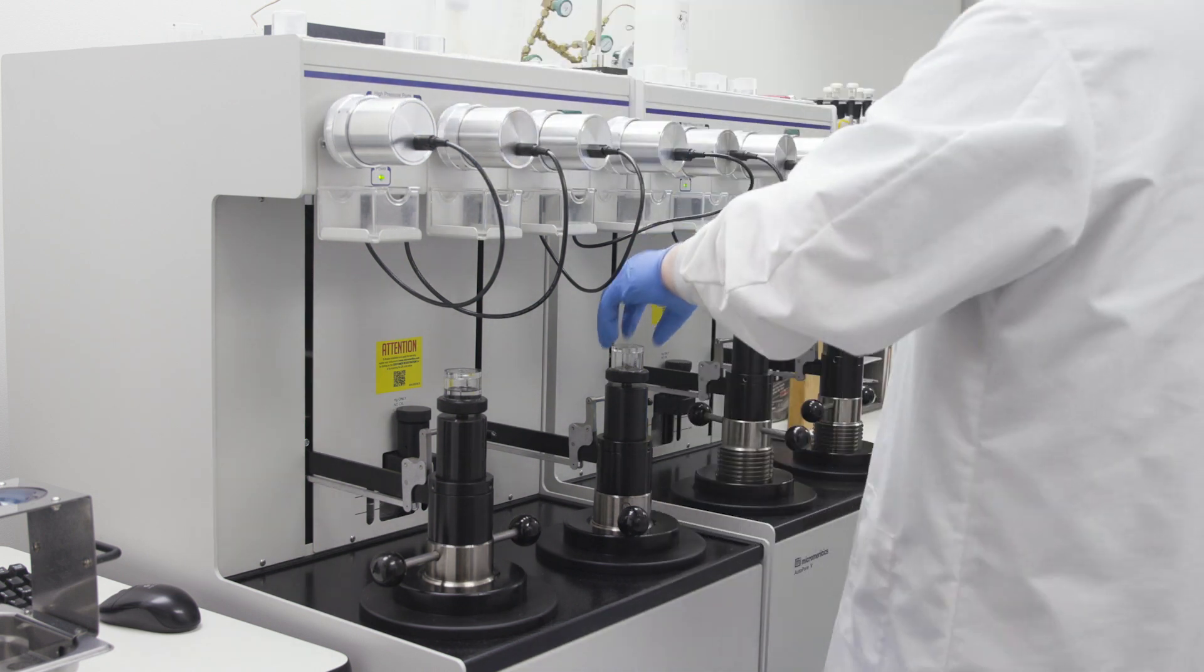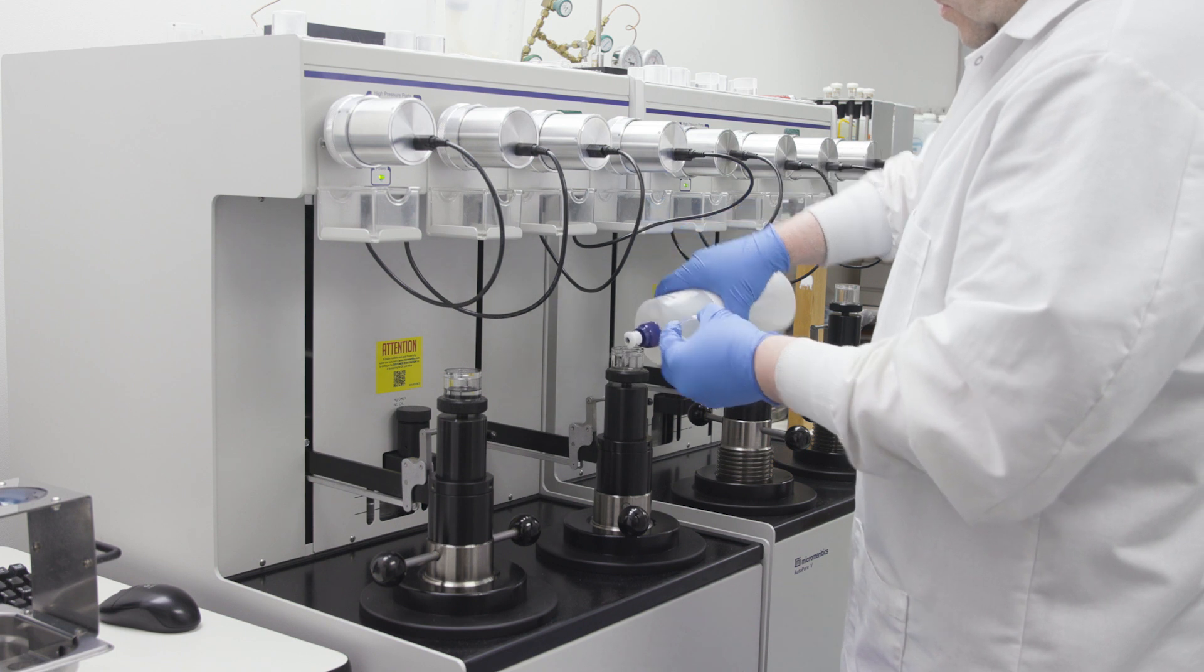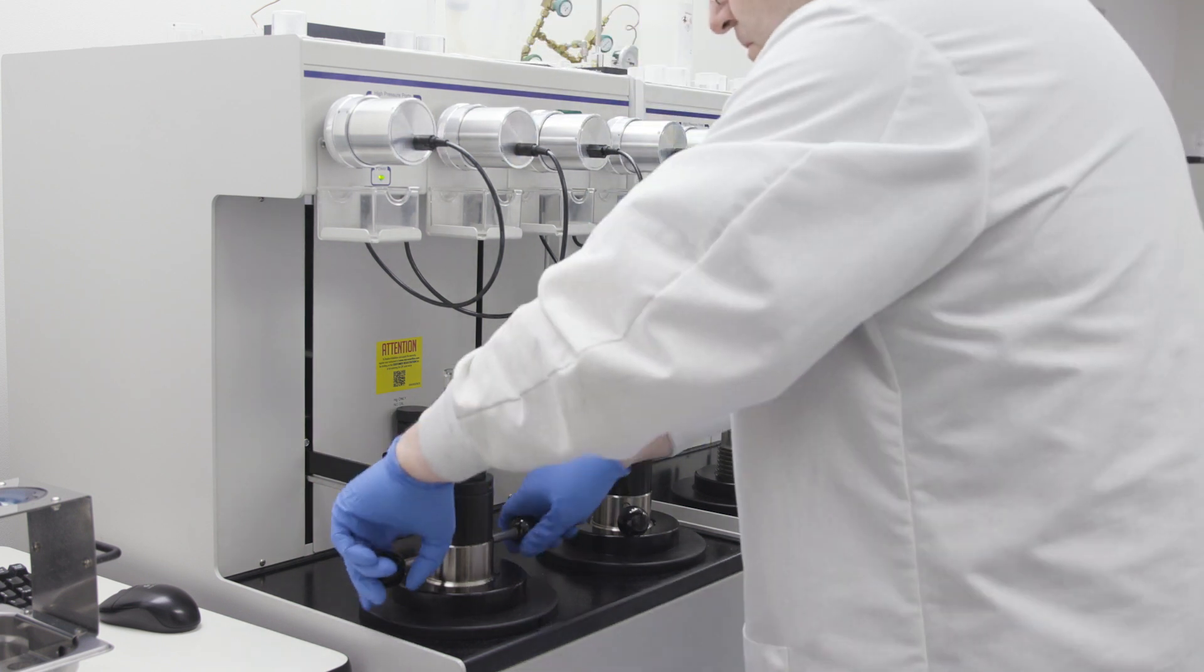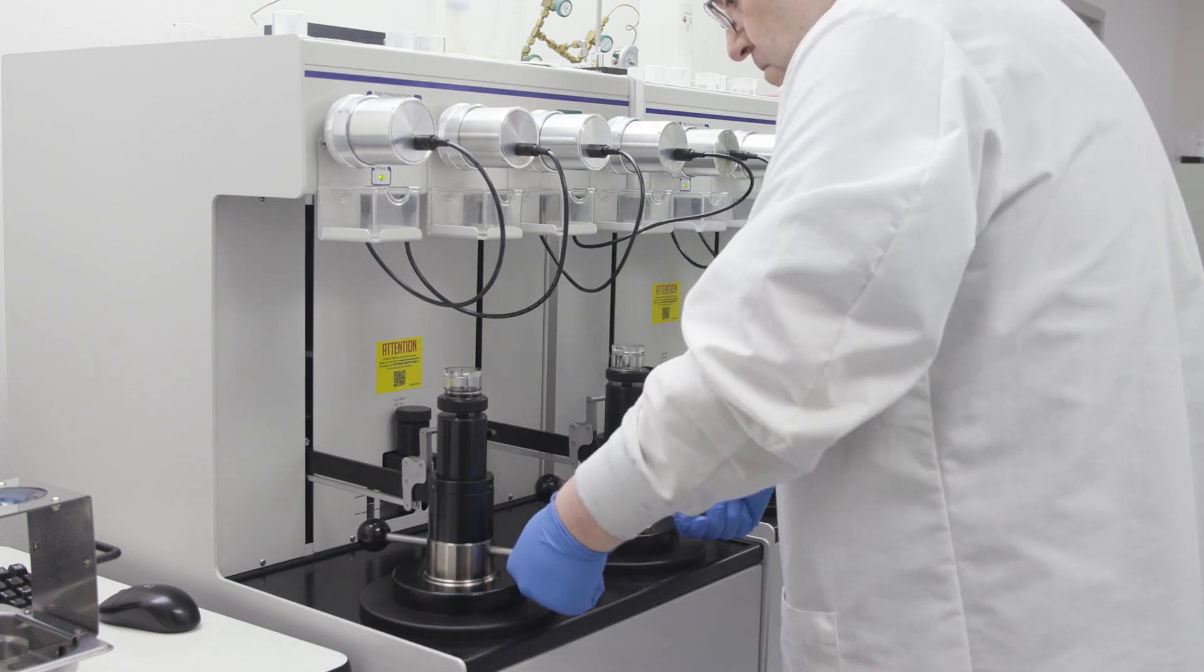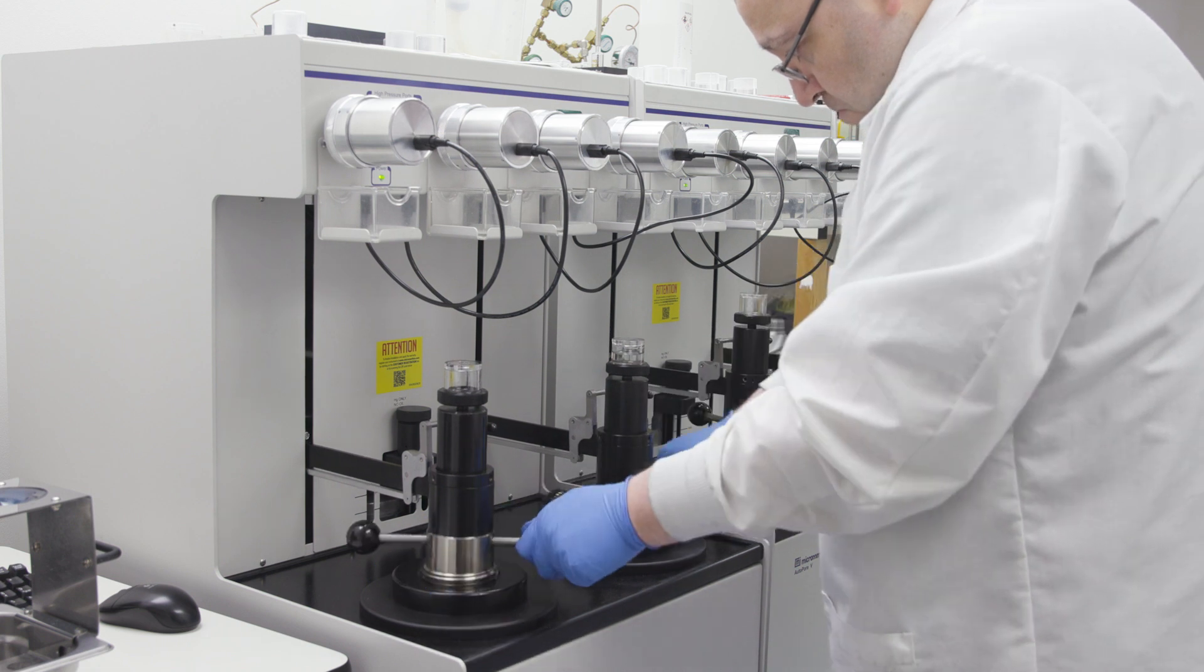That is because the penetrometer occupies some space in the left chamber, but the right one is empty. Chris will add some high-pressure fluid to the right vent reservoir to pull that fluid into the right chamber and to help expel air from both chambers. Chris loosens the chambers then retightens them.